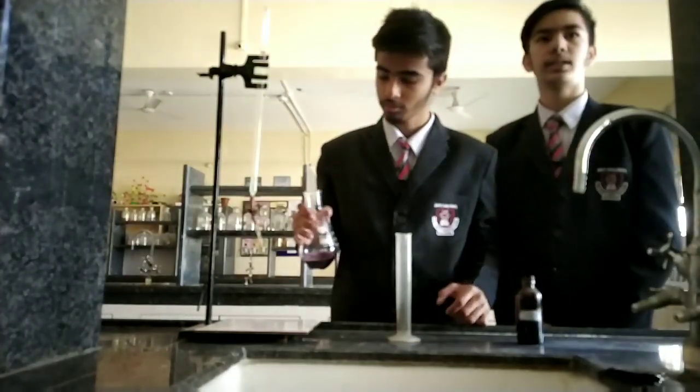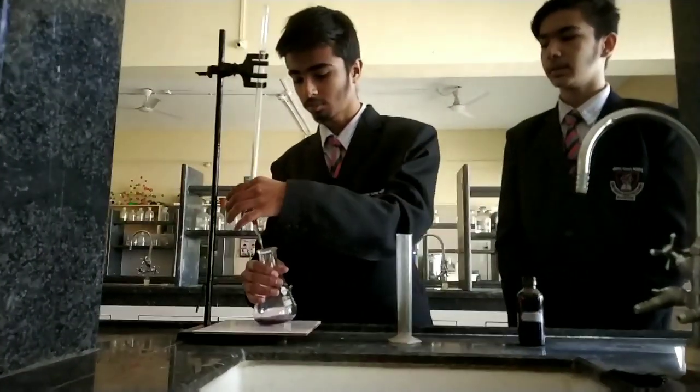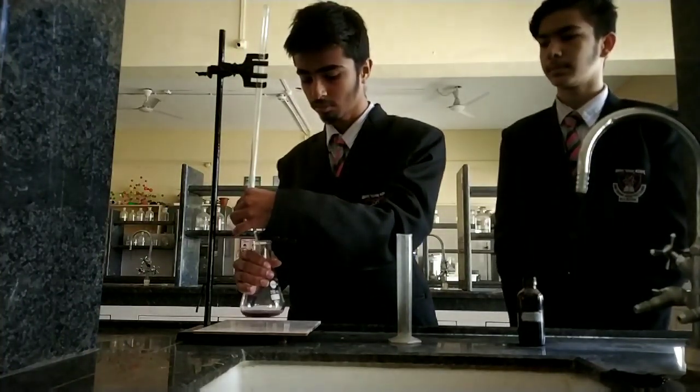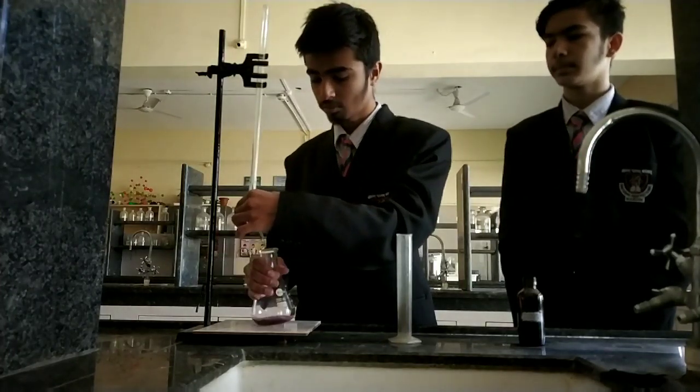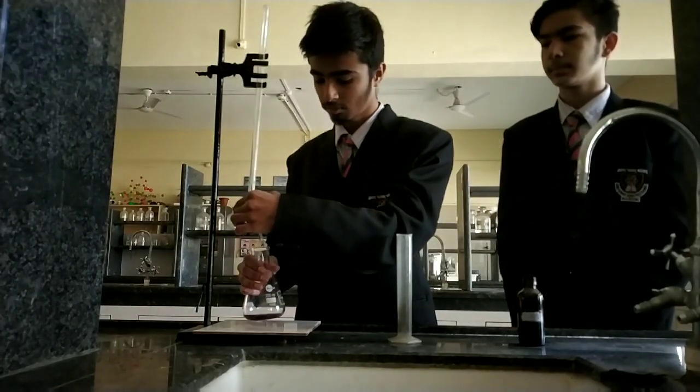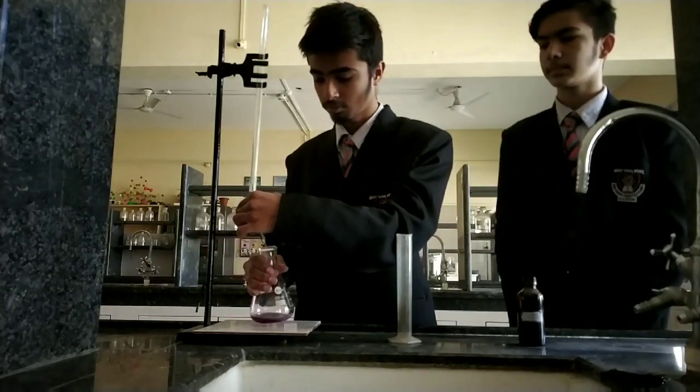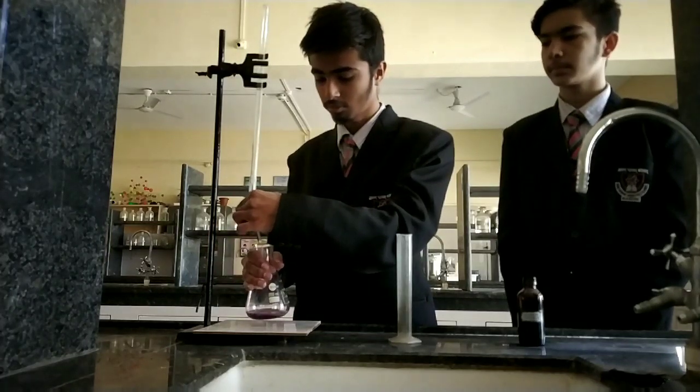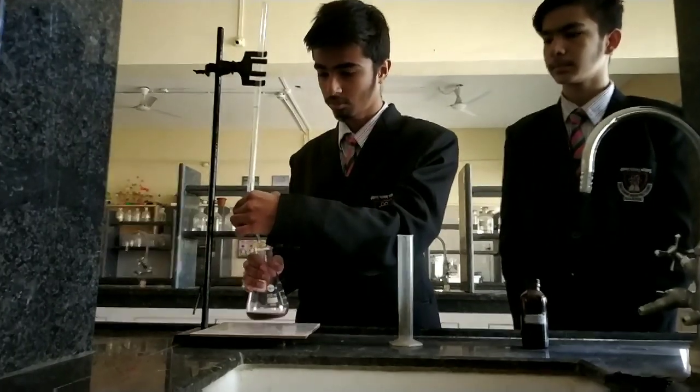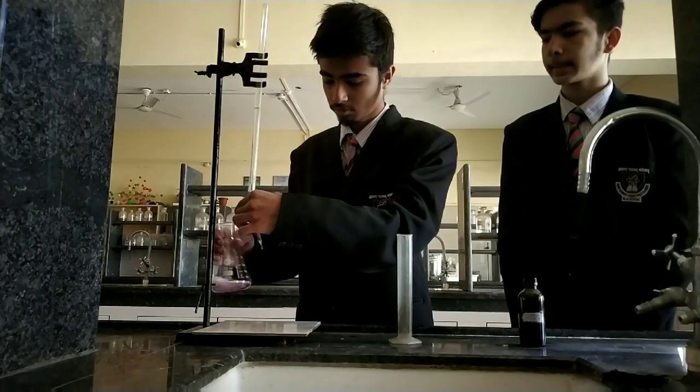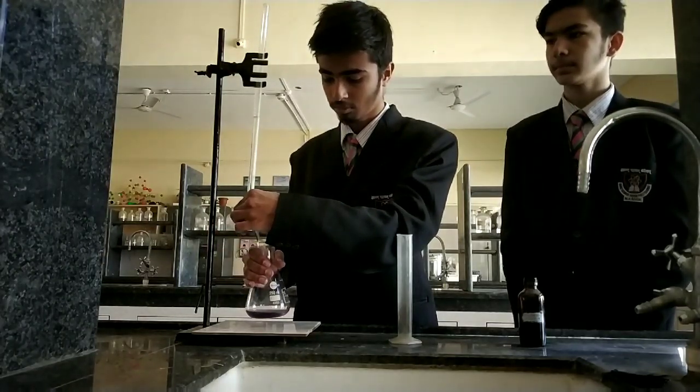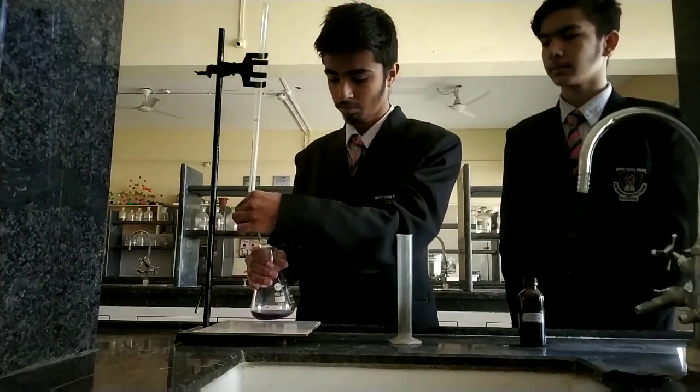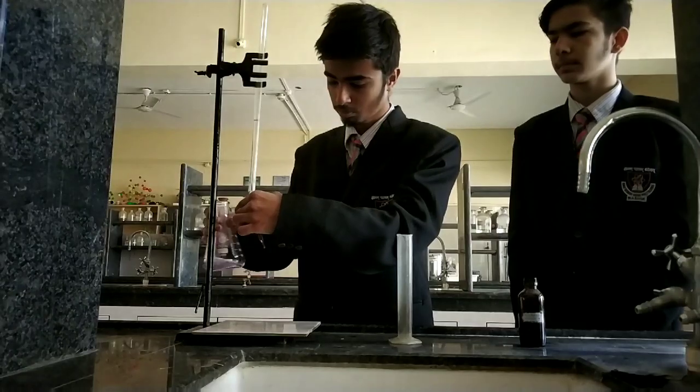After that, we have to titrate it with the EDTA solution until it turns to Blue Color.